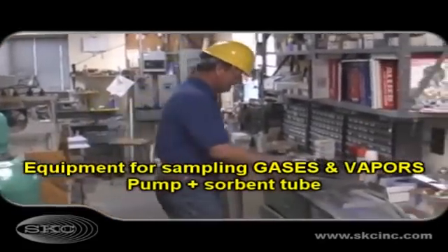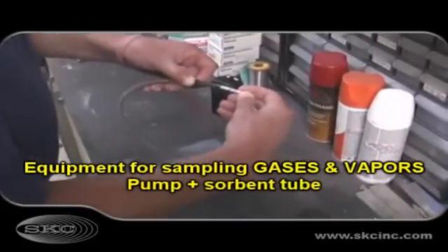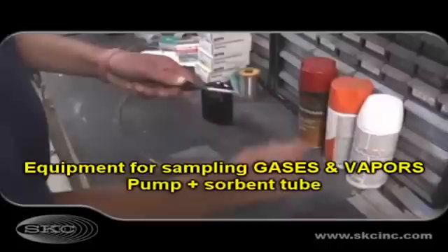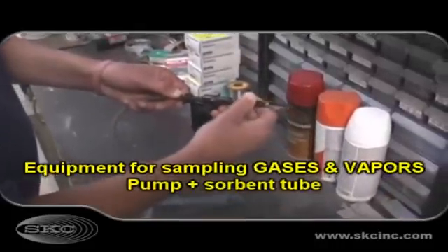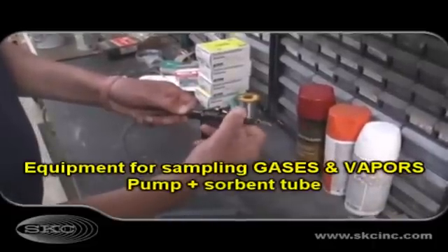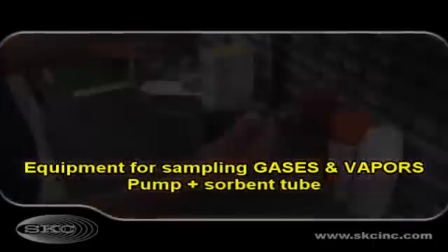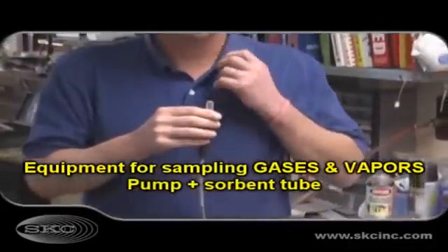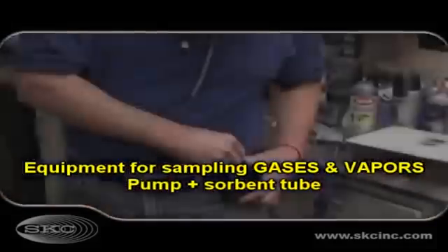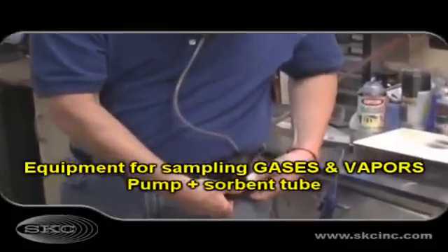To sample gases and vapors, sorbent tubes are the typical sample media. The glass sorbent tube is prepared and inserted into a holder. The holder can be clipped in the worker's breathing zone. The sample media is then attached using connecting tubing to a pump that has been calibrated to the recommended flow rate.